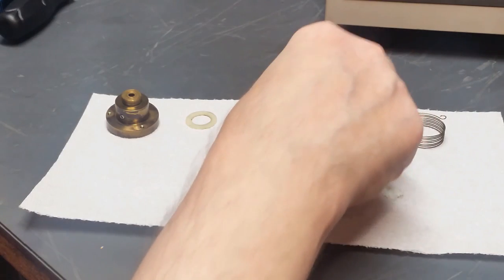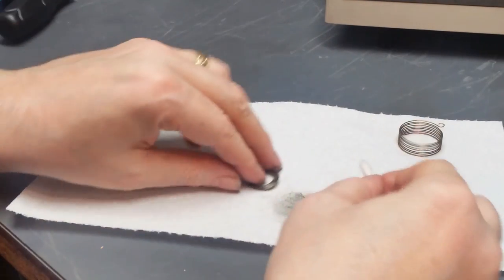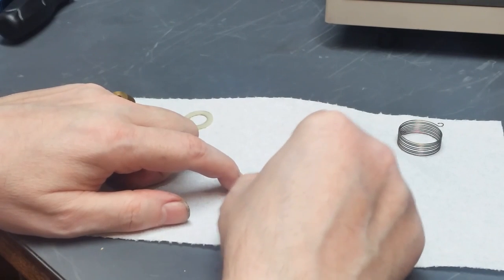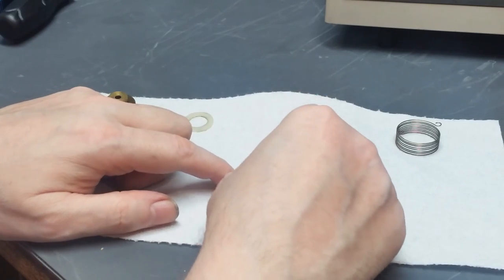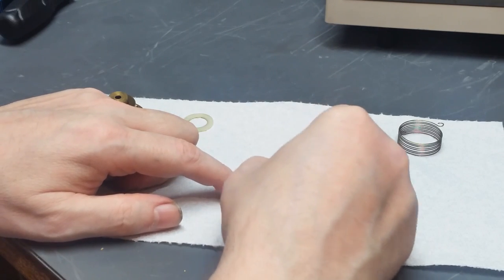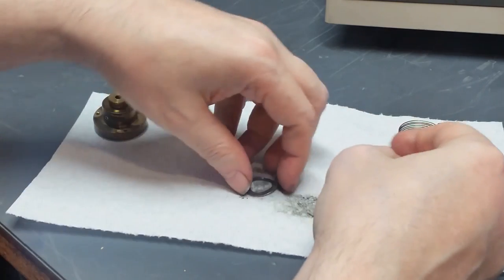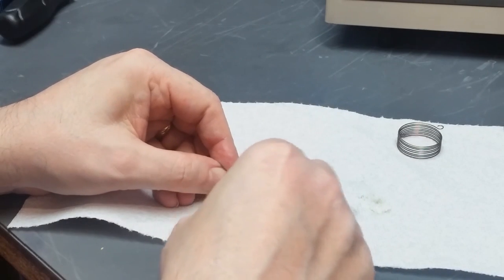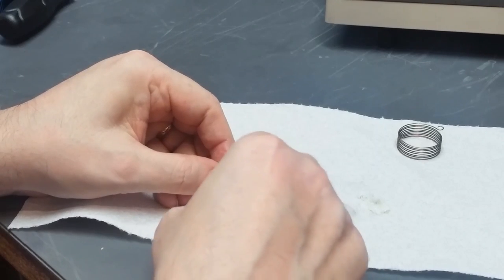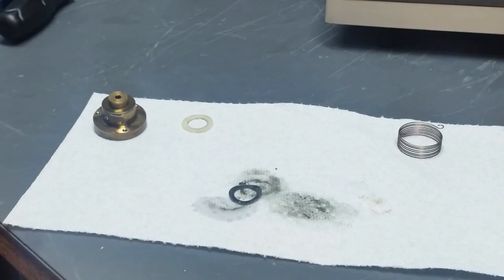Next, I'm going to work on this little wave washer. Get everything off of there. And I'm running low on Q-tips. I need to get me some more. Just clean the backside.